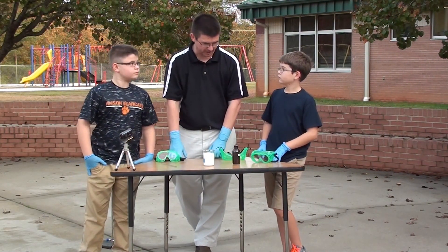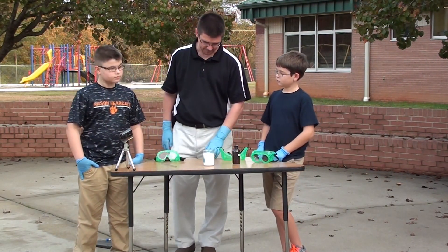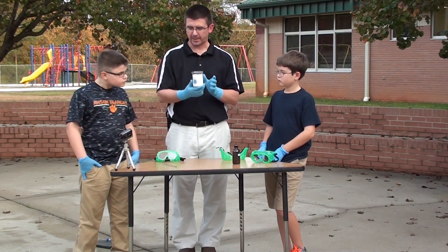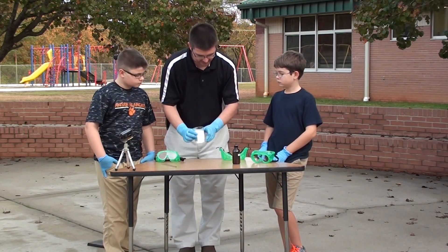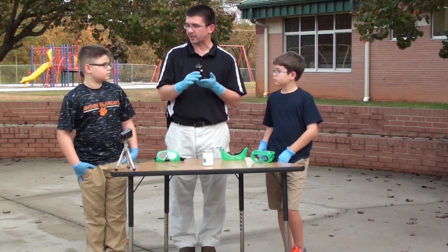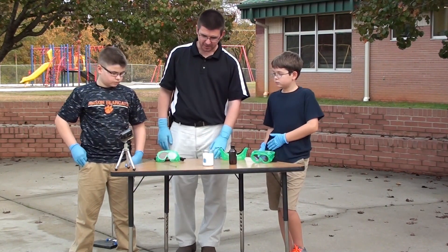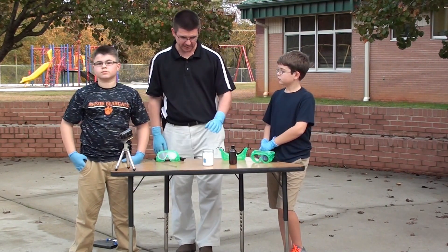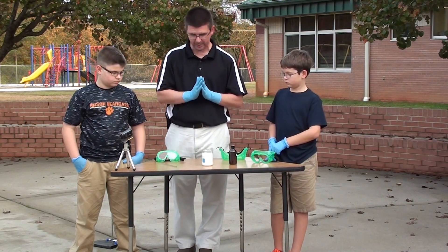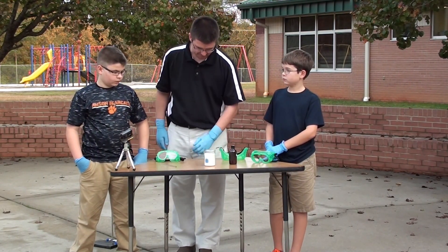We've been talking a lot about chemical changes and we're going to look at a chemical change today between a very common chemical that we use in our homes every day — sugar — and one that maybe we don't use as much, which is concentrated sulfuric acid. We're going to look at a decomposition reaction that's going to cause the sugar to break down into one of its base elements, which is carbon.